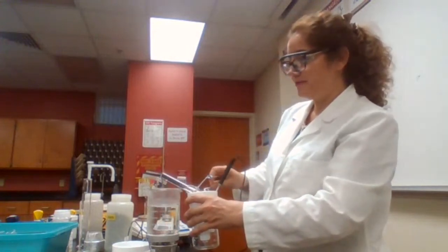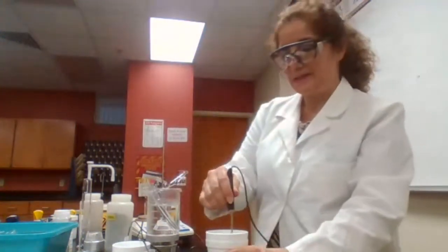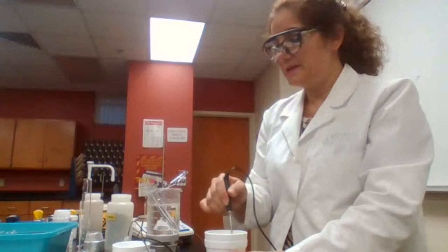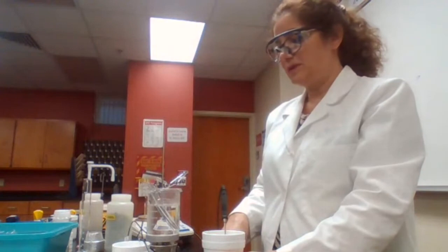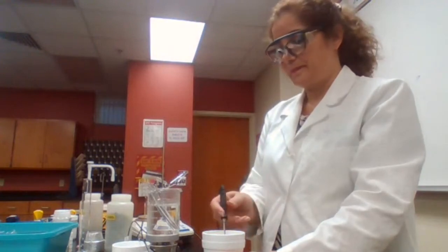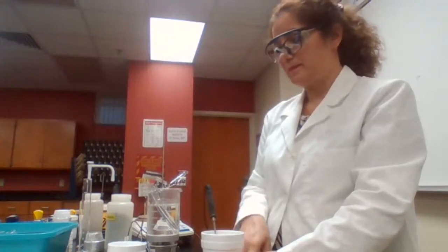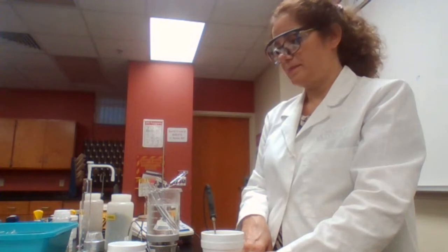So for initial temperature, you have 25.5, right? The temperature now is increasing, and I will let you know what is the highest temperature that it can reach, and we record that temperature. Okay, the highest temperature is 28.0.